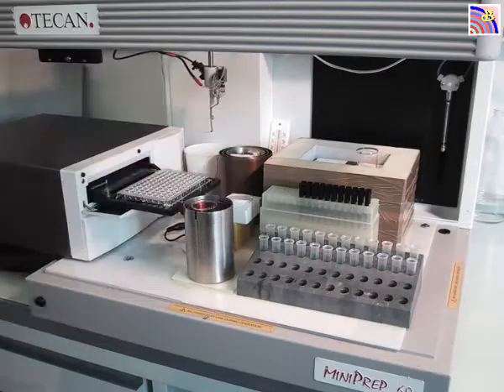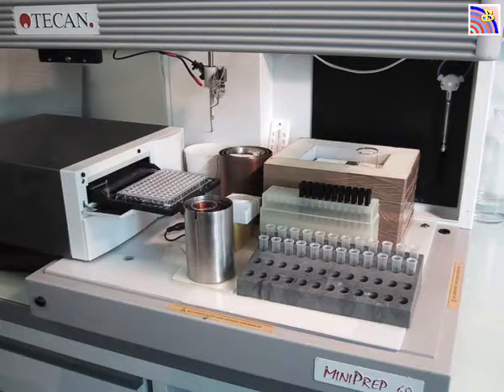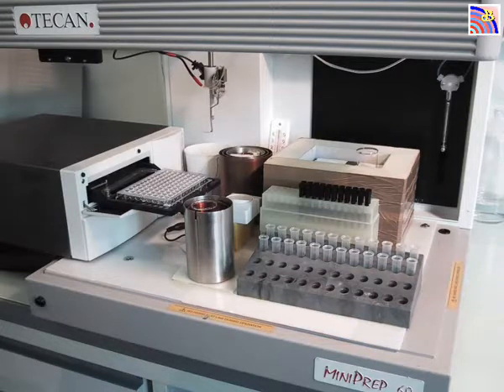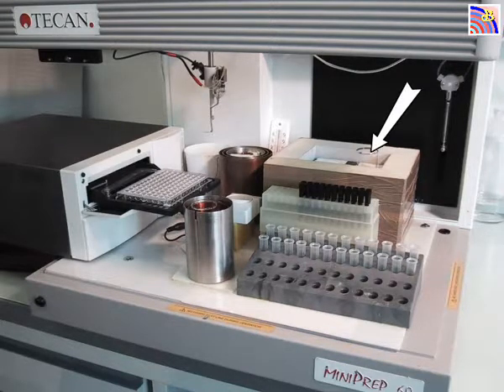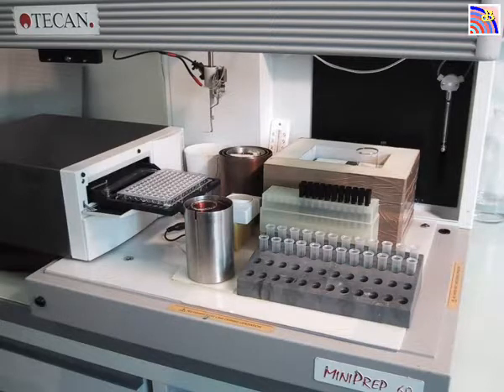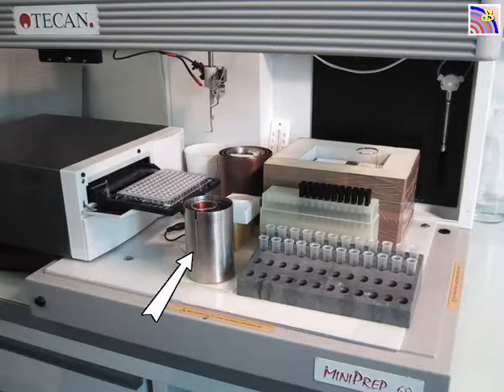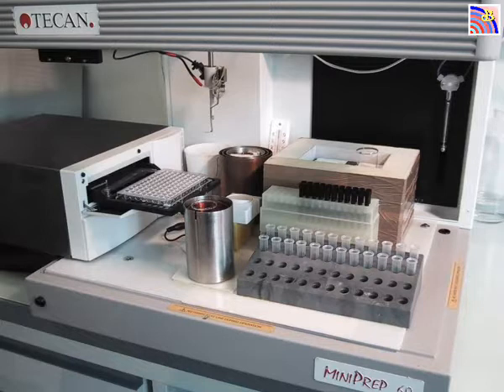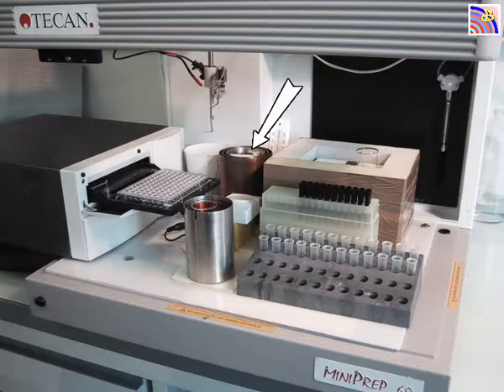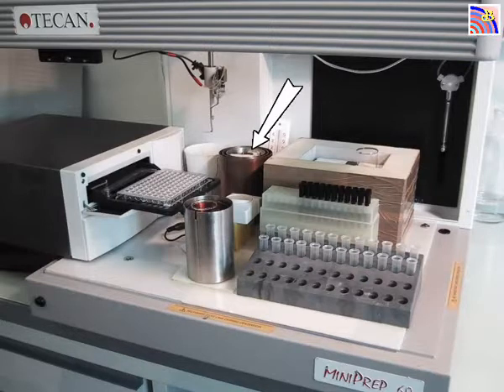On this view, you can see in the front the rack with empty tubes. Behind it, disposable tips that are black, and behind it, a nice box containing the plasma. On the left, the small cylinder contains water added with calcium chloride at a concentration adjusted to start the coagulation of plasma after around 15 minutes. And the copper cylinder on the back contains the coil that will deliver the signal to the water.